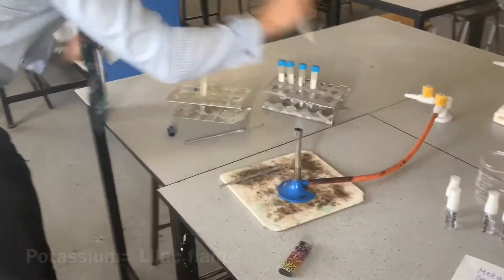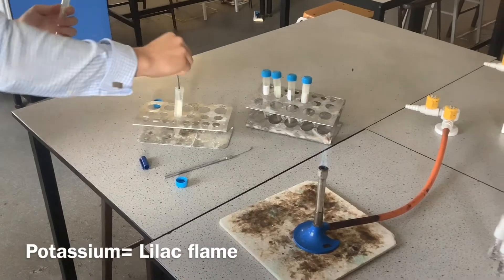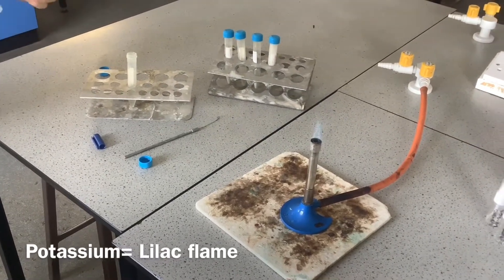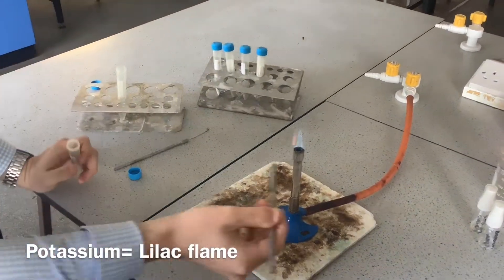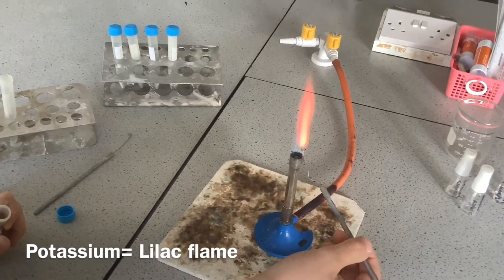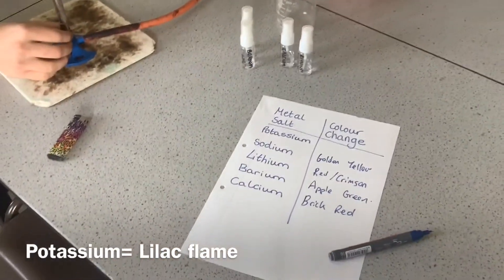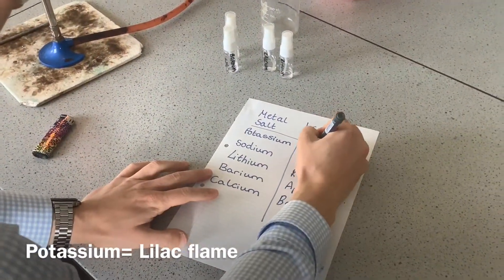And finally we've got potassium. We're looking for a lilac here. There we go — lilac. So I'm just going to record that in my table of results. Those are the five ions you need to know. So we've got lilac.